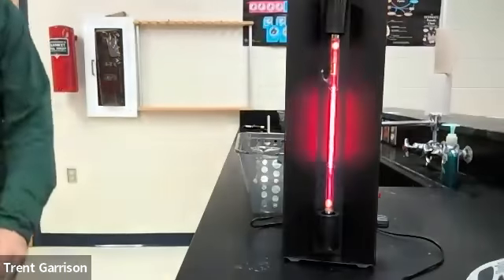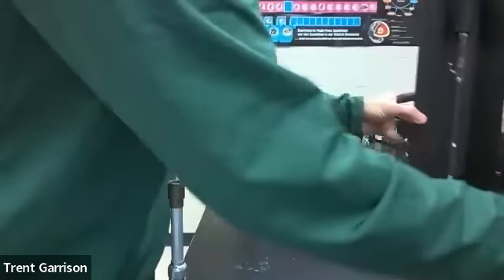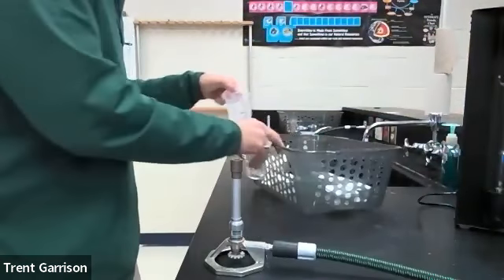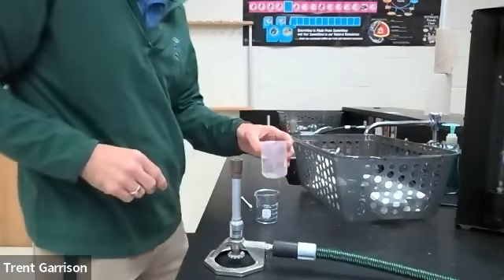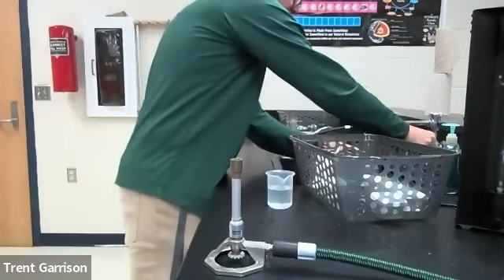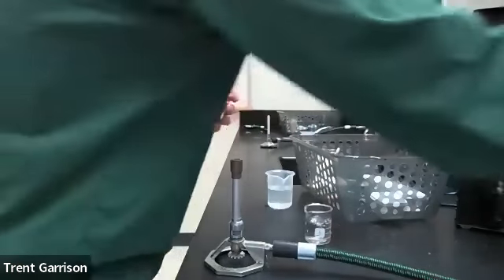Okay, now, next part, we're going to light a nice little flame. So I'm going to move this out of the way, and we are going to light a little flame here. And we are going to do chemical analysis now, not neon analysis. So what I've got is just a nice little beaker of water here, and then I'm going to have a dirty beaker of water so that I can put out my flames after they are done.